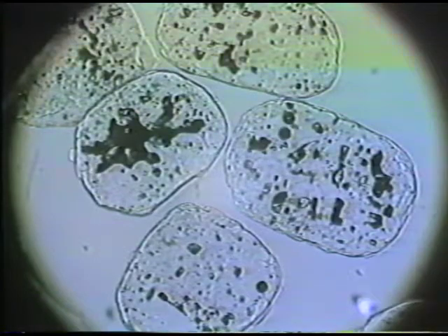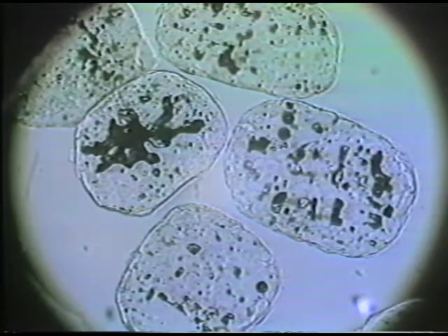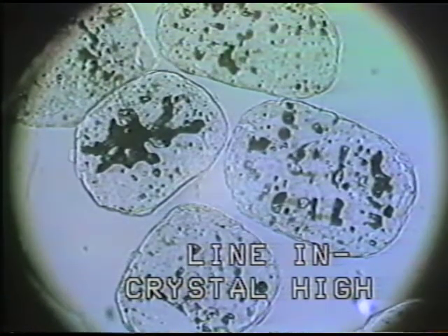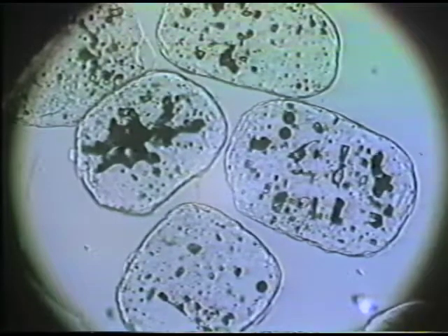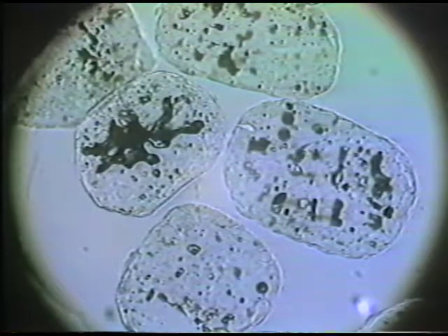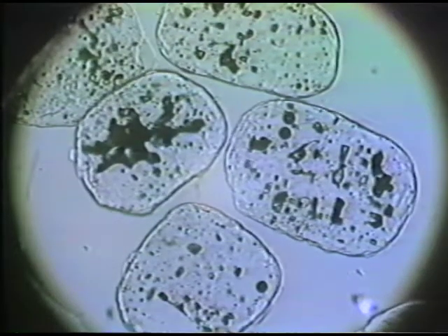This indicates that the refractive index of this crystal is now higher than the refractive index of the mounting material, or we can say it has positive relief. And we can also see in this mineral grain that the crystals have a bit lower relief. They're now characterized by low positive relief. In the first mount, they had moderate negative relief. So we can characterize both the sign of the relief and the degree of the relief by careful observations. And our objective really is to close in on the refractive index of this isometric mineral.